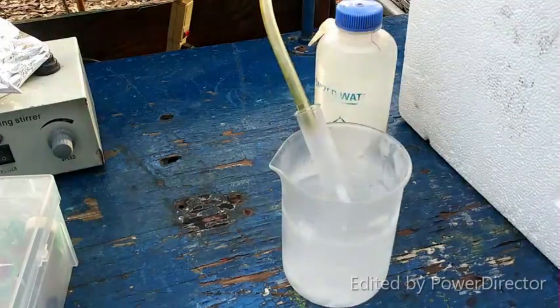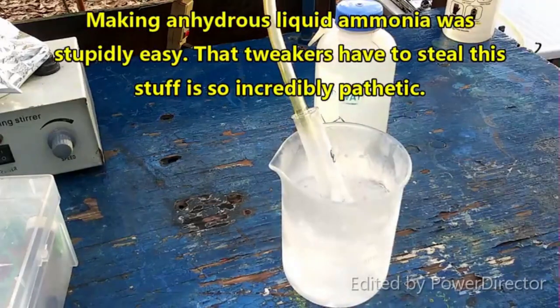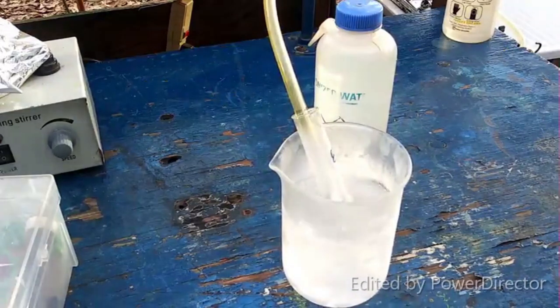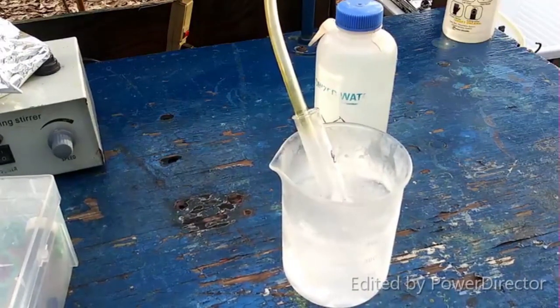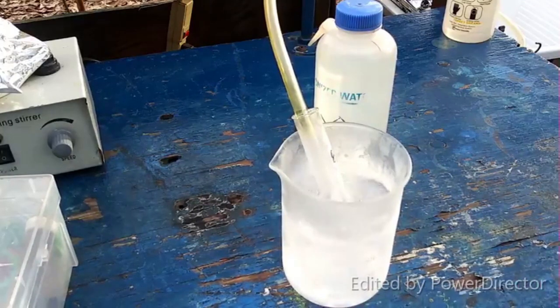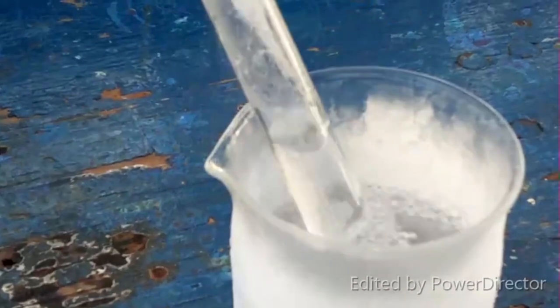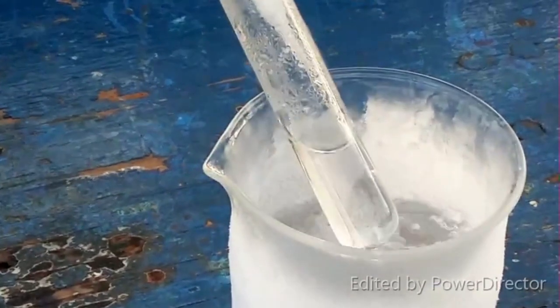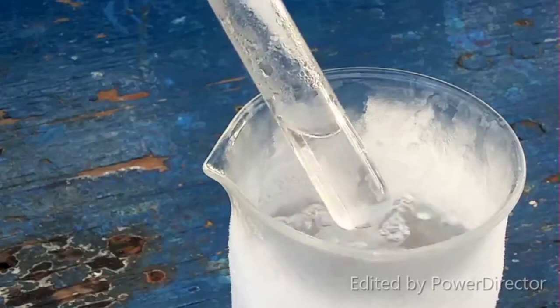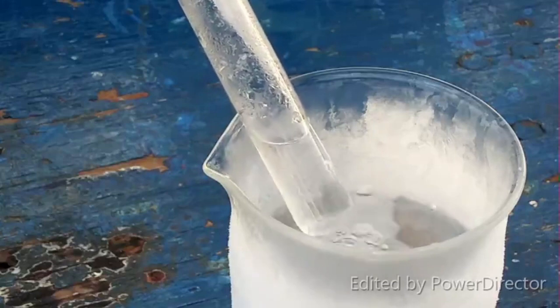All right, it's happening — let me bring you in here and show you guys this. Look at that! The bubbles disappear before they even make it to the surface. I don't know if that's showing up, but that is so cool. As for worries about enabling people — I'll retreat to my normal defense that this stuff is already out there on YouTube, so I'm not showing anything new.